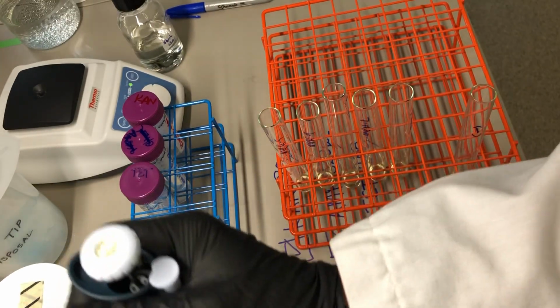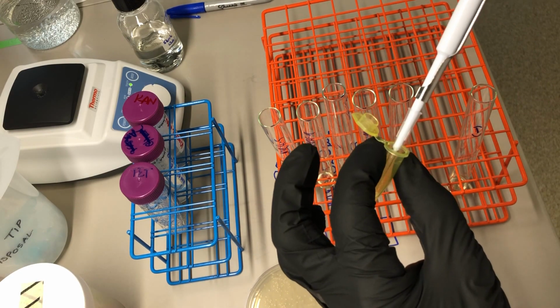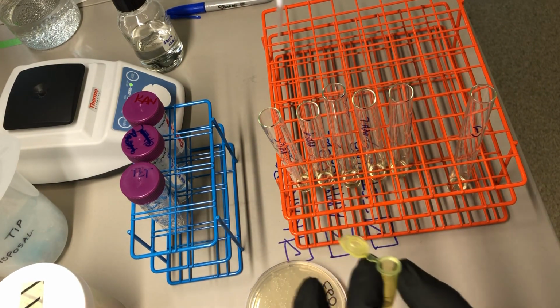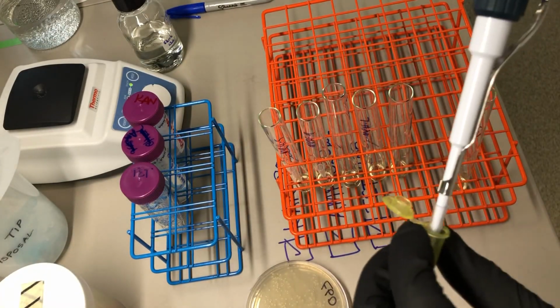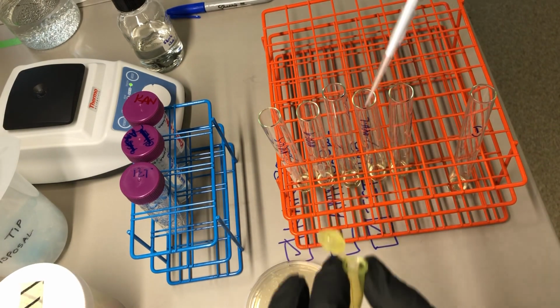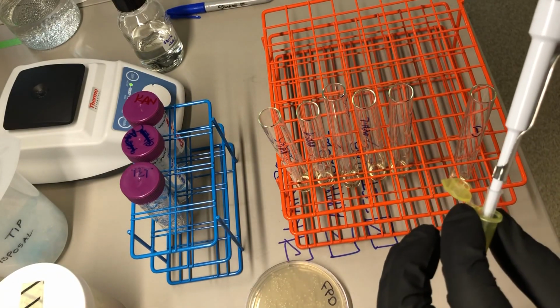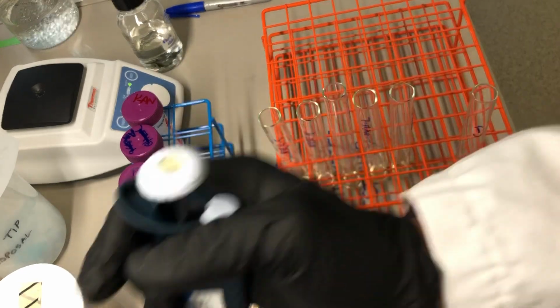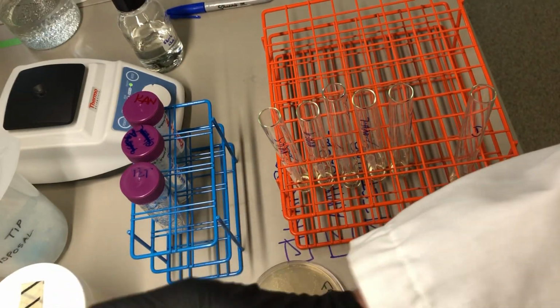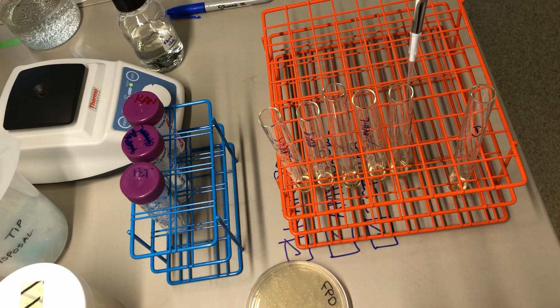Let's do that again. We're going to do that 4 more times. Pipette up and down. Remove the liquid. Leave the liquid behind. Center your tip over the mouth of the tube and then eject. Empty. No liquid, just cells. Pipetting up and down gets some of the cells onto the plastic of the tip, and then we leave most of the cells behind. We want to start with just a few cells.